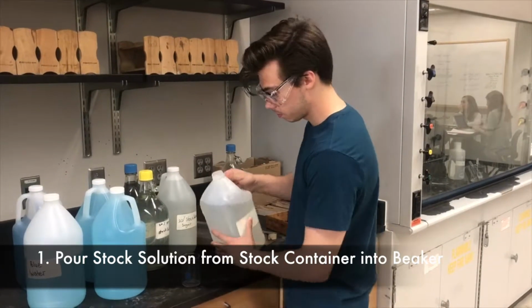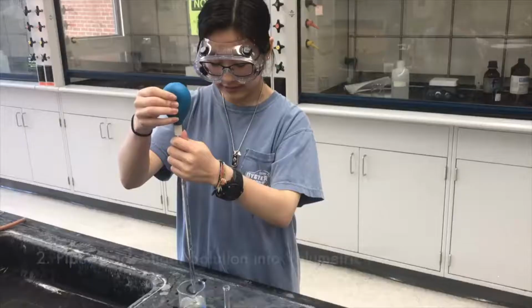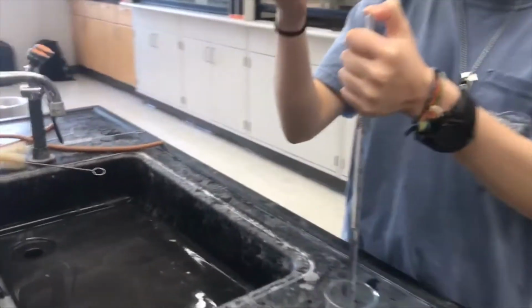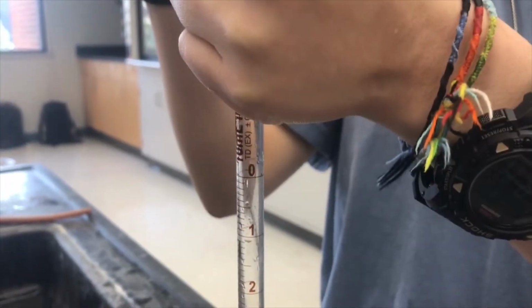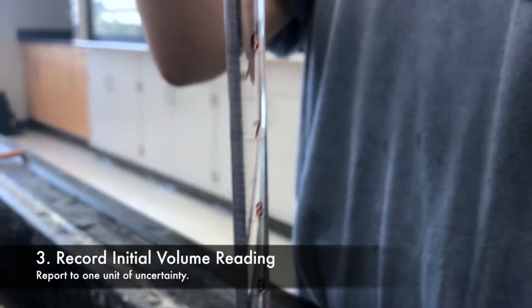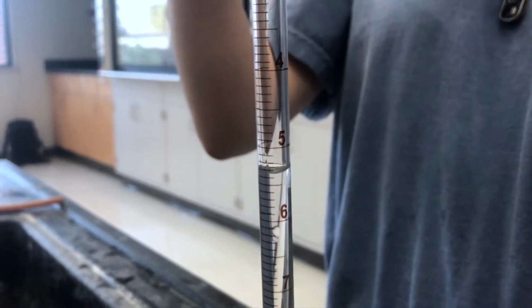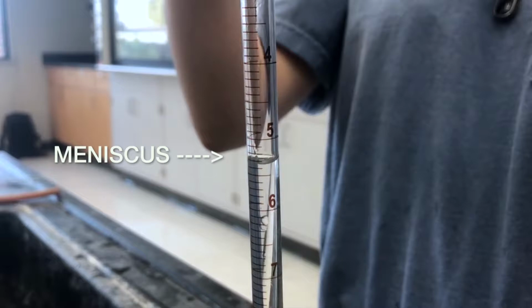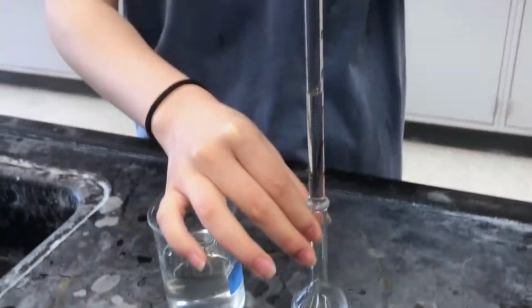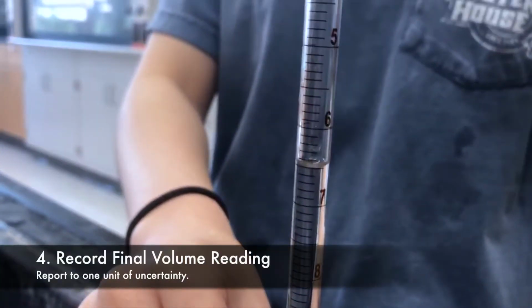Time to get started. First, pour the stock solution from the stock container into a small beaker. Using a graduated 10 ml pipette, draw some sugar solution from the small beaker and record the initial volume to 1 unit of uncertainty. When reading the graduated pipette, it is important to read the volume level from the bottom of the meniscus. The meniscus is the crescent shape that forms when liquid molecules are attracted to the sides of the container. Dispense a small amount of the sugar solution from the pipette into a volumetric flask. Record the final volume to 1 unit of uncertainty.